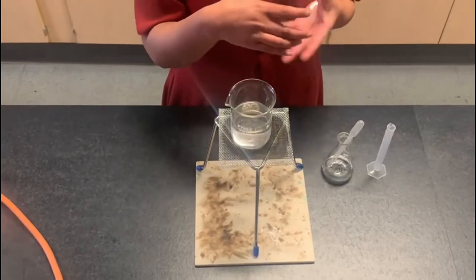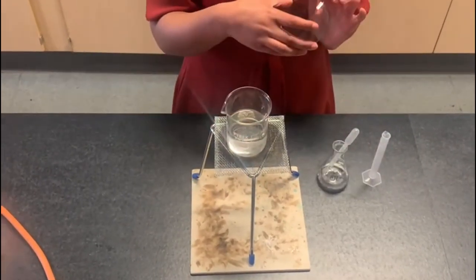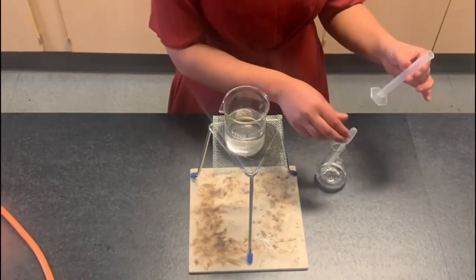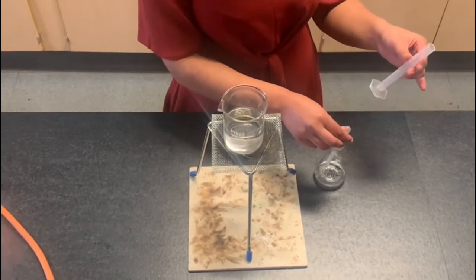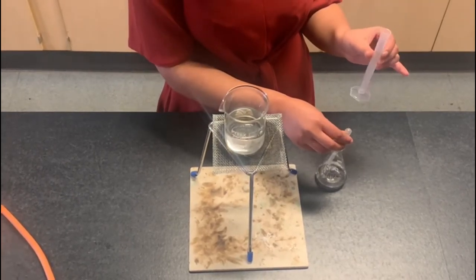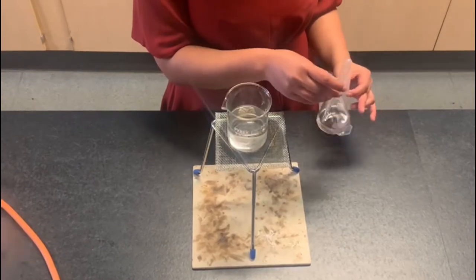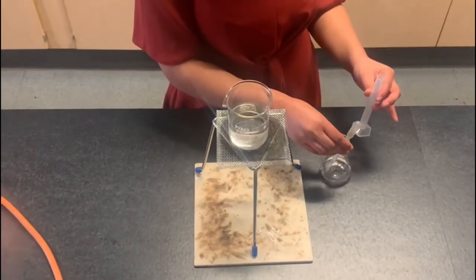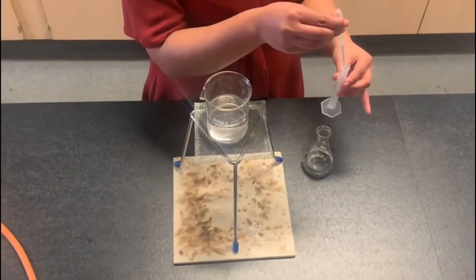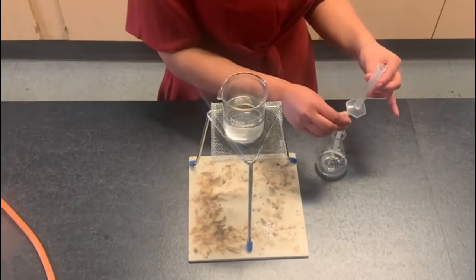onto a watch glass that we pre-measured, we're going to roughly measure out 4 milliliters of our sample. So firstly we're going to use the seawater. Let me just do that now. We're going to use a measuring cylinder. We need to come down to eye level to make sure it is the right amount and yes perfect.